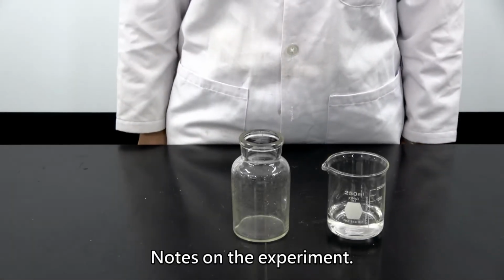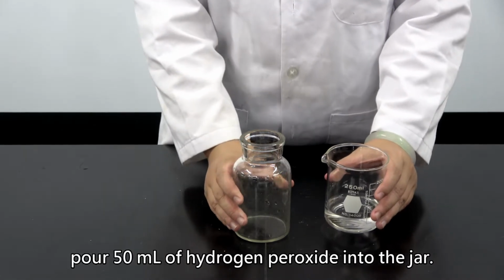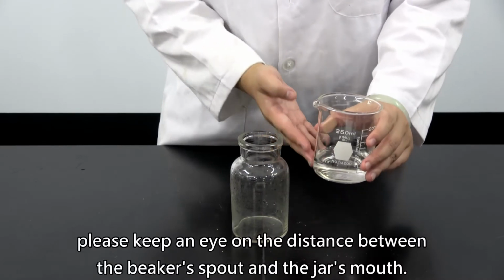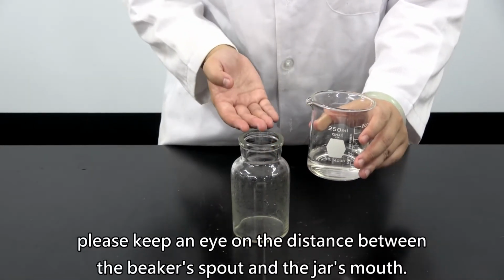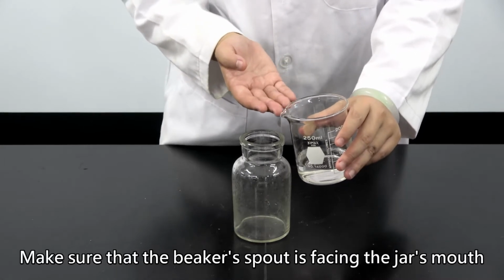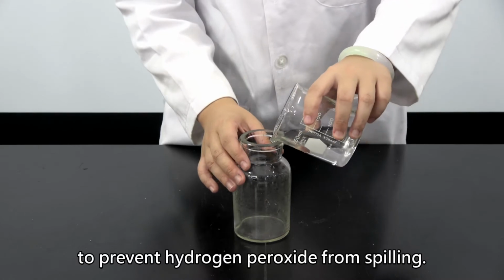Notes on the experiment. Step 1. Pour 50 ml of hydrogen peroxide into the jar. When pouring hydrogen peroxide, please keep an eye on the distance between the beaker spout and the jar's mouth. They should not be too far apart from each other. Make sure that the beaker spout is facing the jar's mouth to prevent hydrogen peroxide from spilling.